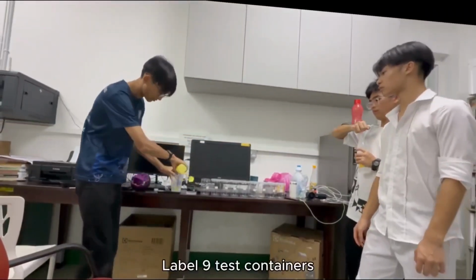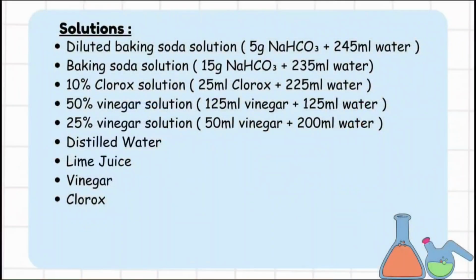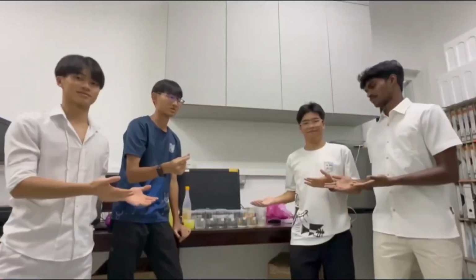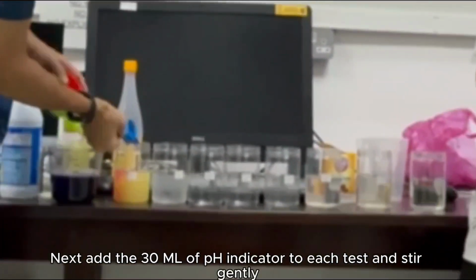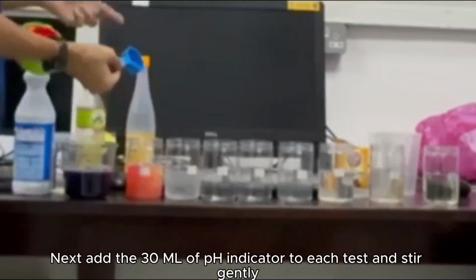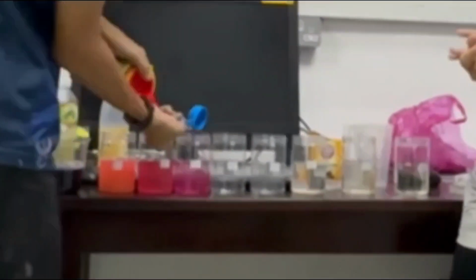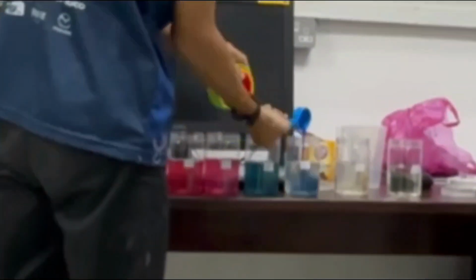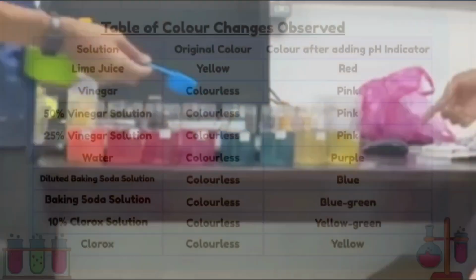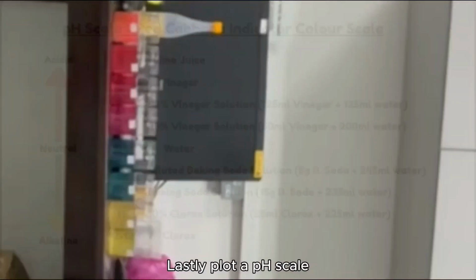Label 9 test containers 1 to 9 and prepare solutions as shown. Next, add the 30 ml of pH indicator to each test and stir gently. Observe and record the color changes. Lastly, plot a pH scale.